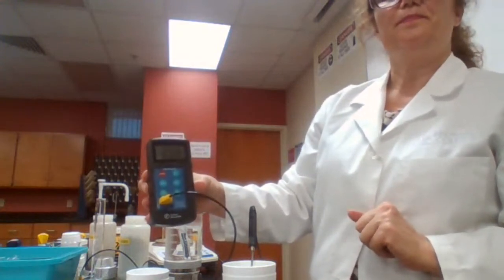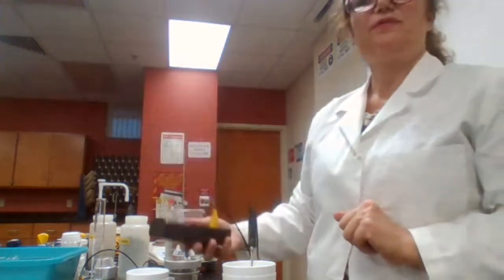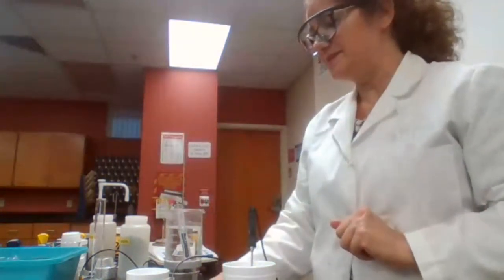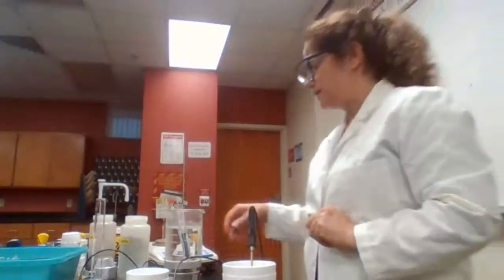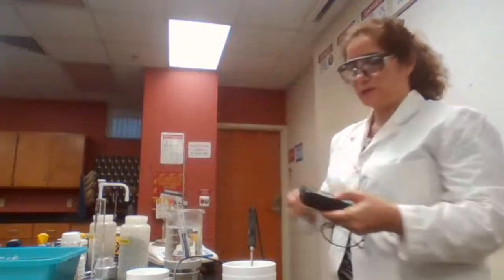You got it? 25.5 was fluctuating between 5 and 6, but we can use that. 25.5. Let's see if this one works.